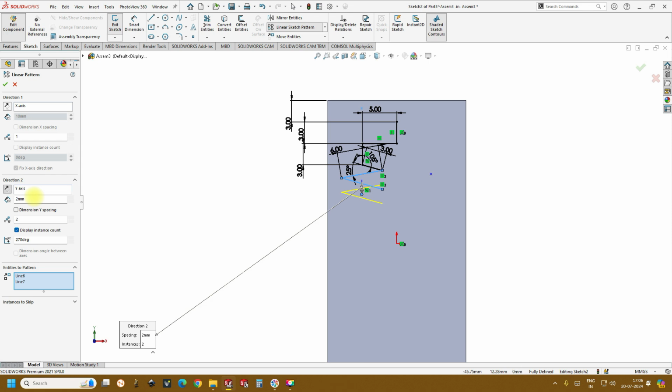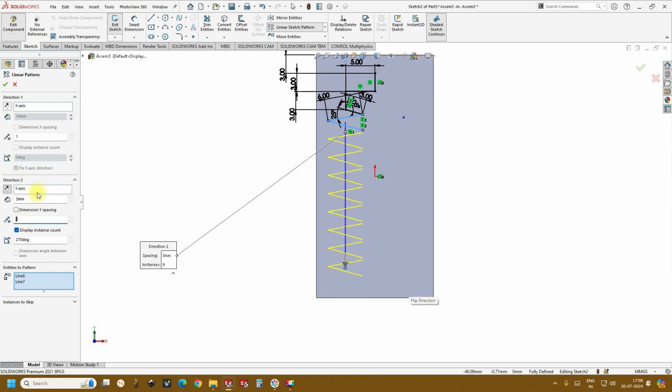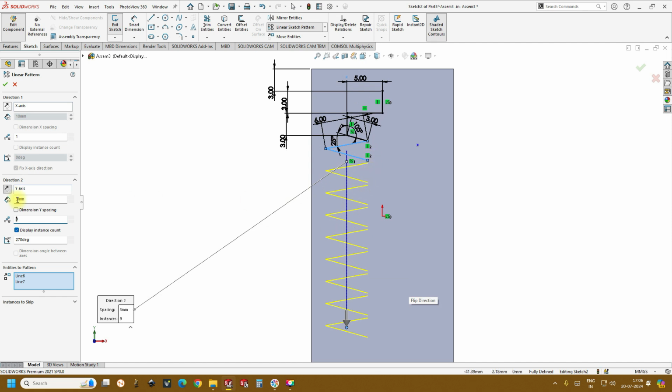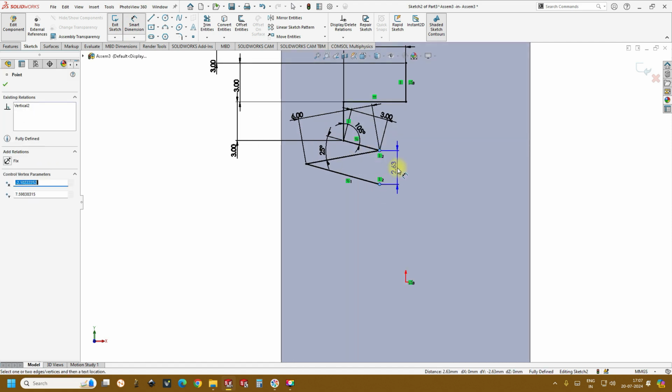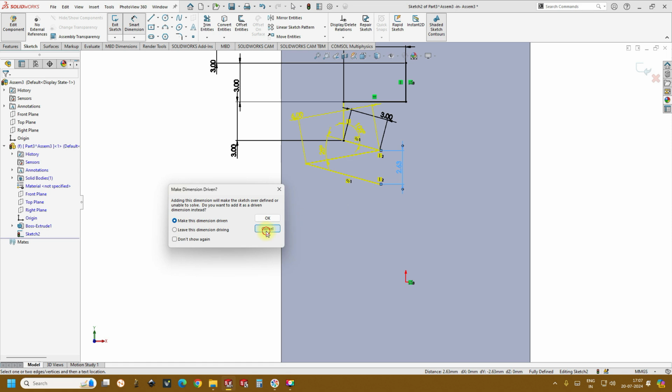2 mm is intersecting. Okay, so let's make it close to 3 mm. So now this is not intersecting, and followed by, we can increase the number. Since already 1 is there, we change this to 9. Okay, and this is also separated, so let's find out the distance. Go to smart dimension, check the distance. This is close to 2.63.